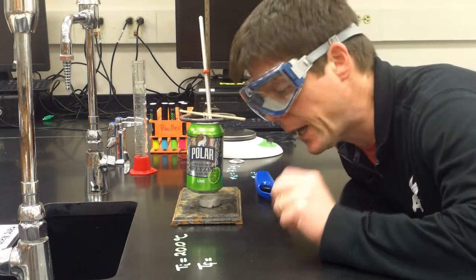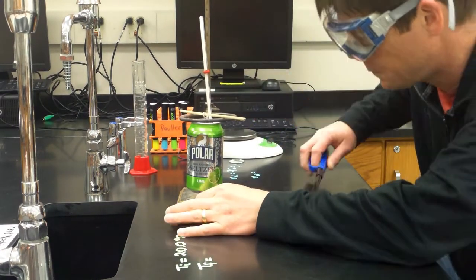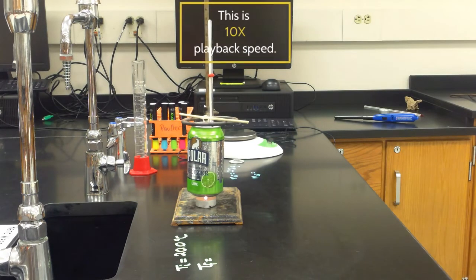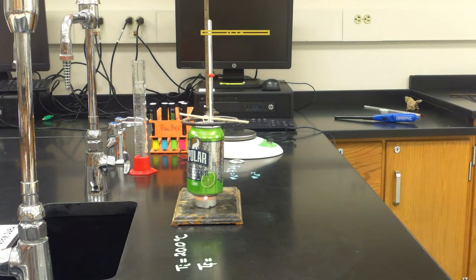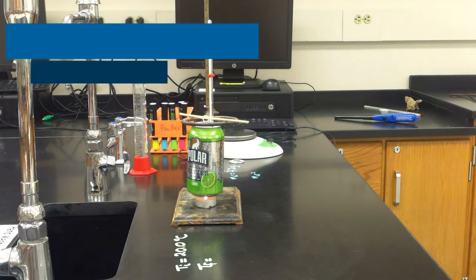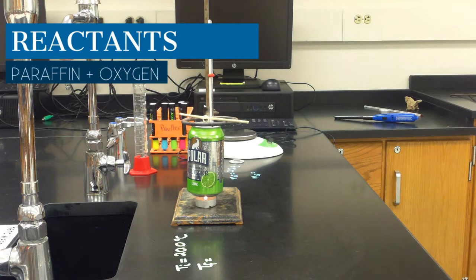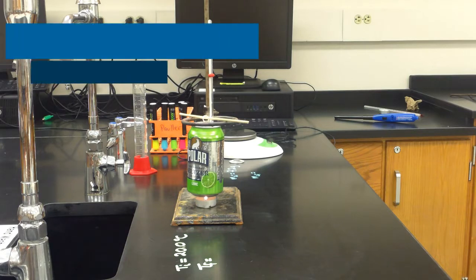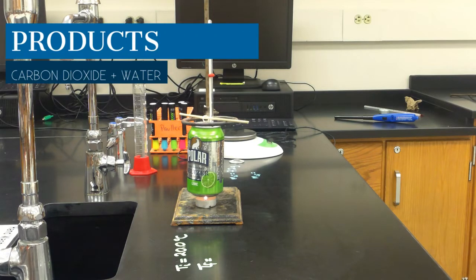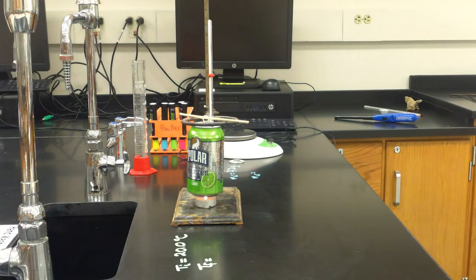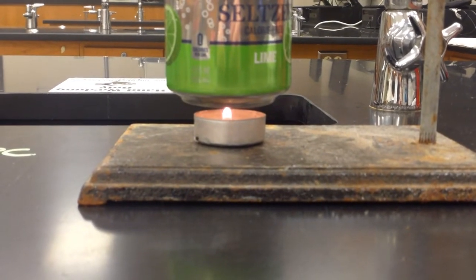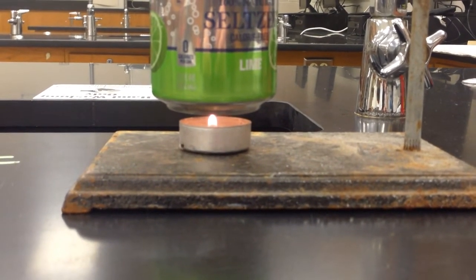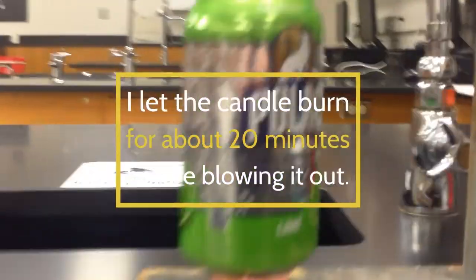Alright, so now we're ready to light the candle. So as that wax is burning, there's energy being given off all the time, and that energy is transferring into the can causing the water in the can to heat up.